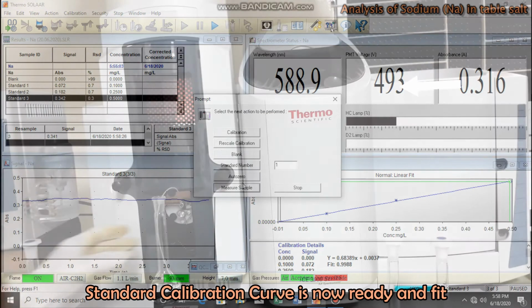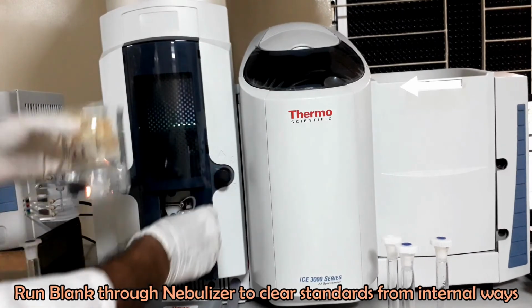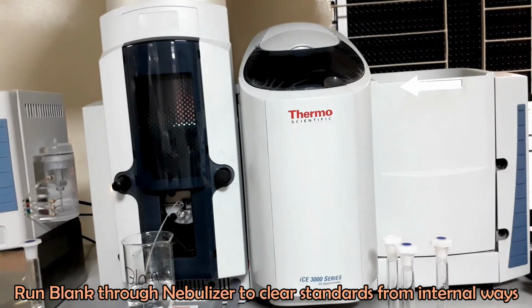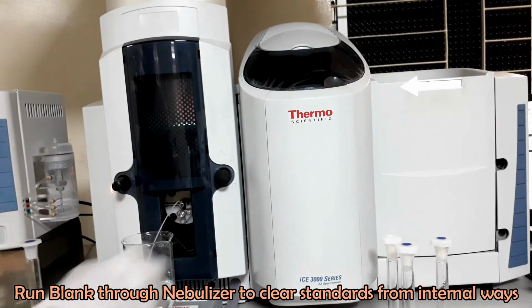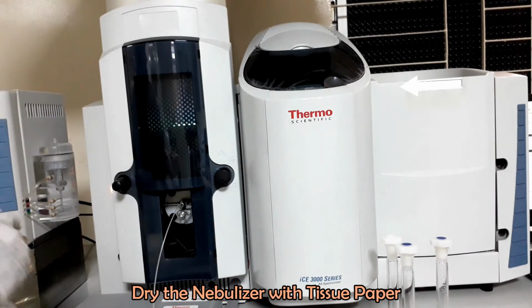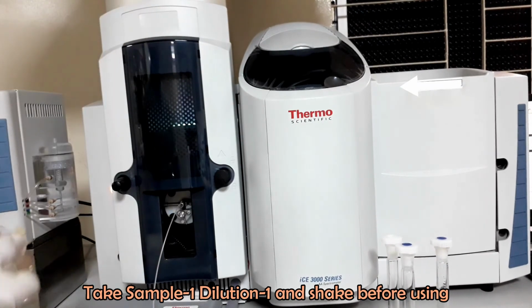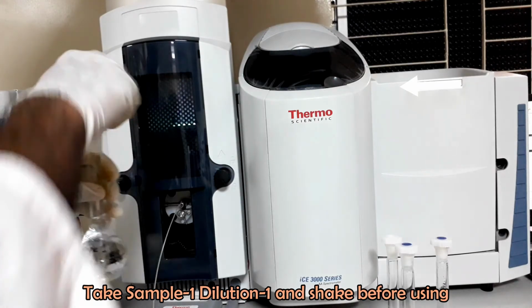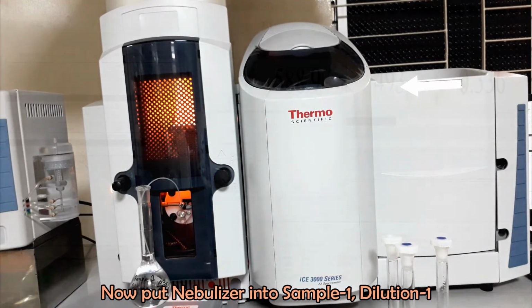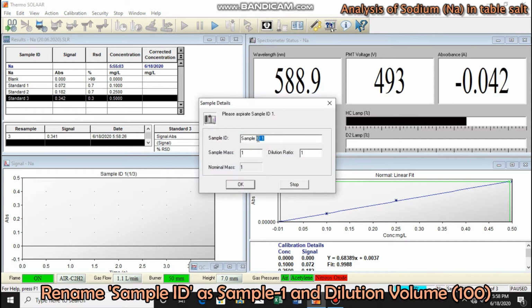Our standard curve is fitted successfully. Now run diluent or blank through the nebulizer to clear the standard residues from the channel. Remove the blank. Dry the nebulizer and insert it in sample 1 dilution 1. Click on Measure Sample. Rename the sample ID and click OK.